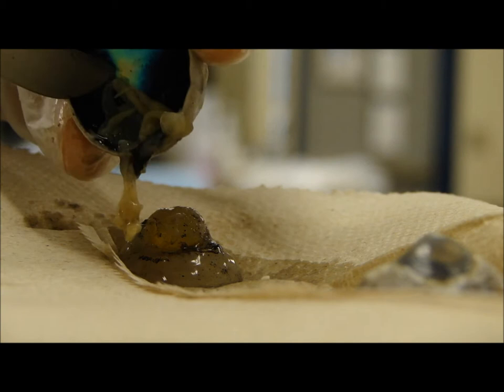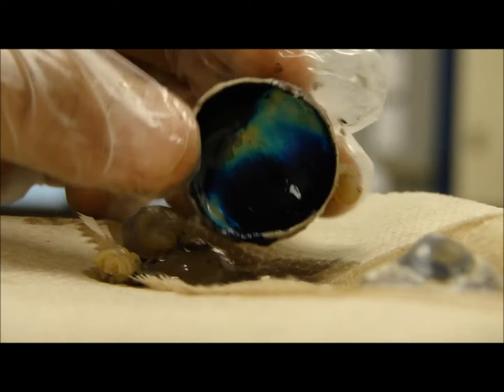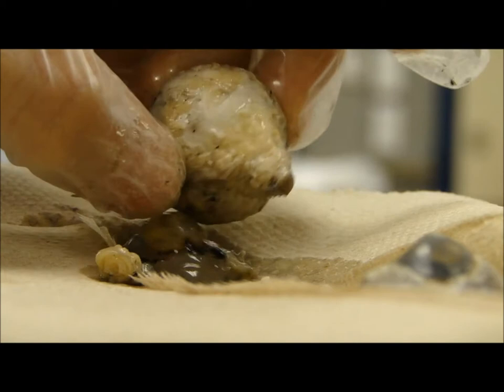What other juices do we gotta get out? You have to take all that out? I'm just taking stuff off it — it's like an oyster. I told you that. Look at the inside, it's so pretty. That's so cool. It is so cool.